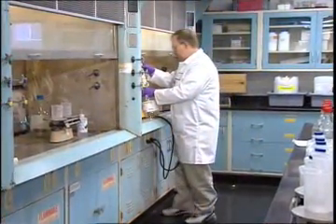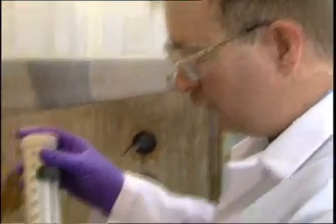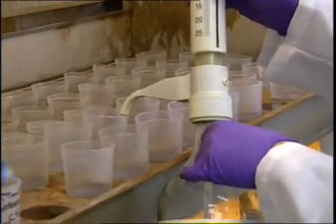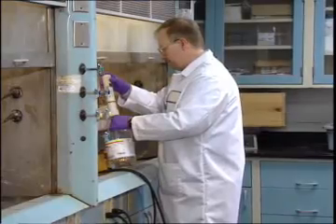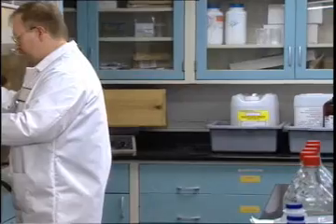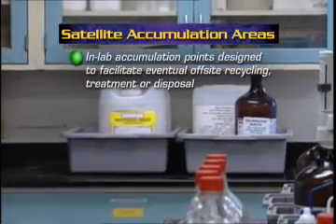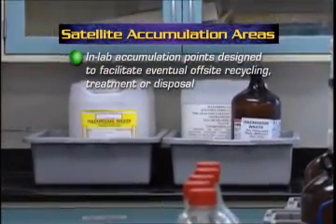Most hazardous waste will be collected on-site and accumulated before eventual shipment to an off-site facility for recycling, treatment, or disposal. Accumulation often starts in a cabinet or at a designated area of a bench located right in the lab or research operation. These in-lab accumulation points are called satellite accumulation areas.